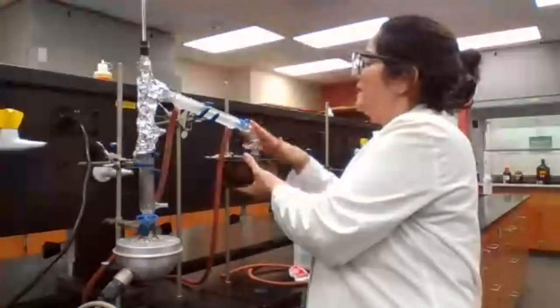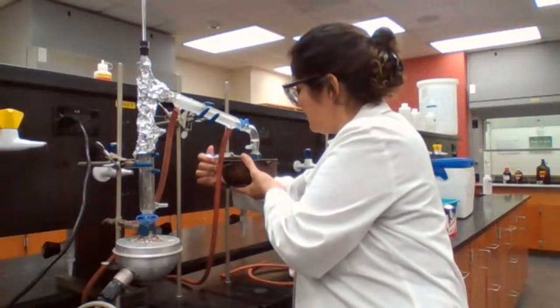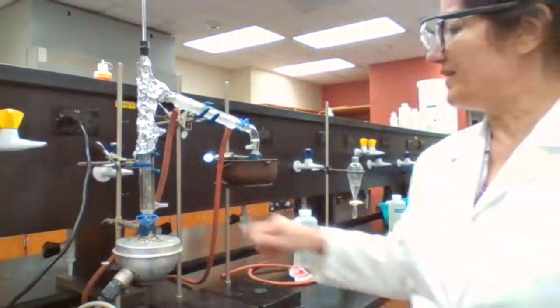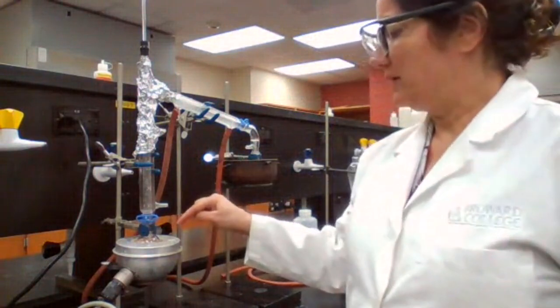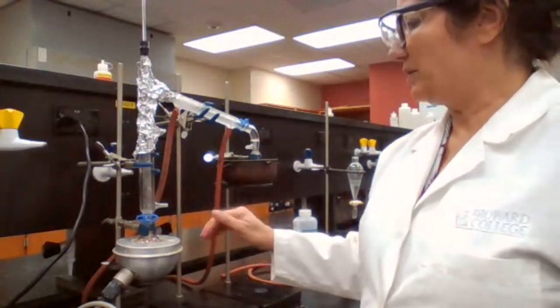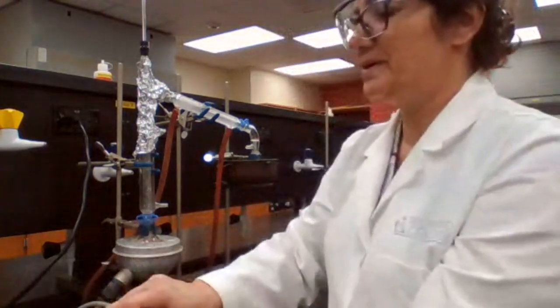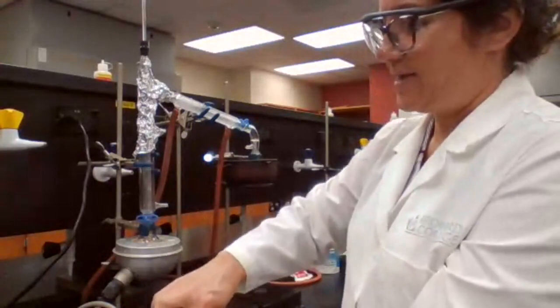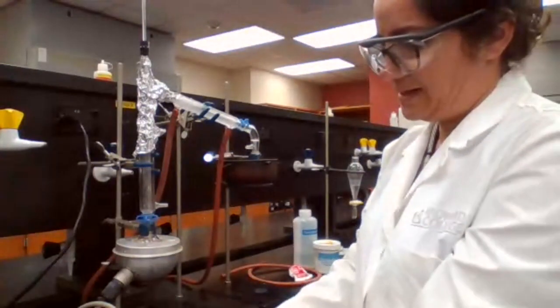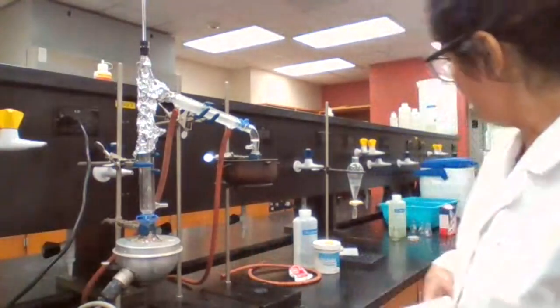The drops are all the way here, but have not dripped down. It's coming slowly. Okay, good. We have to make sure to stop the distillation before it dries out. Also, you should never distill to dryness. That can break the glass. It can crack the glass. It can overheat the sample and the glassware.